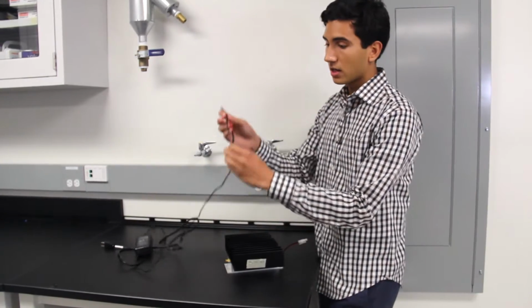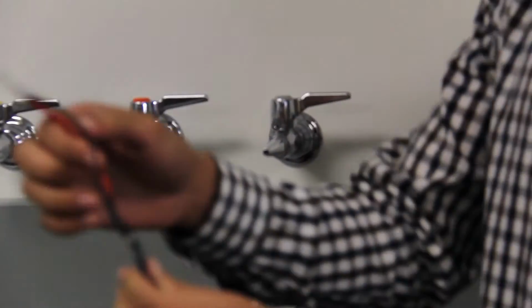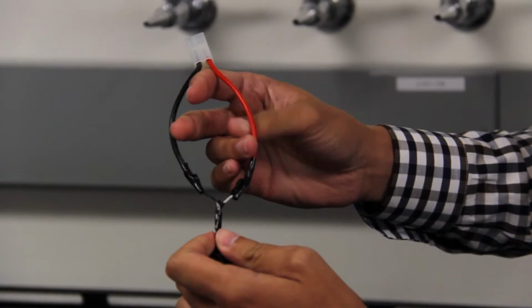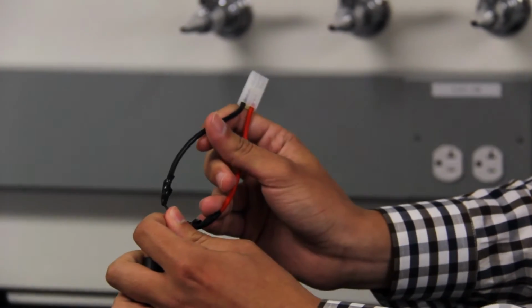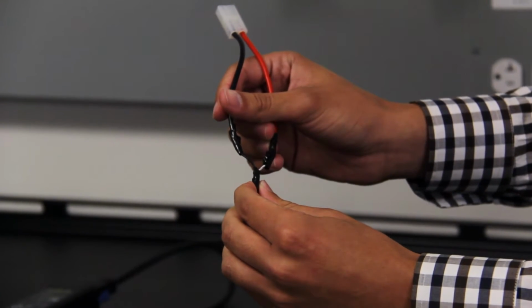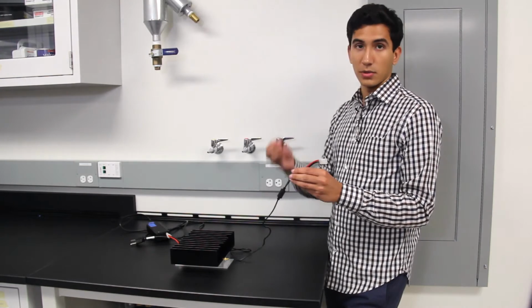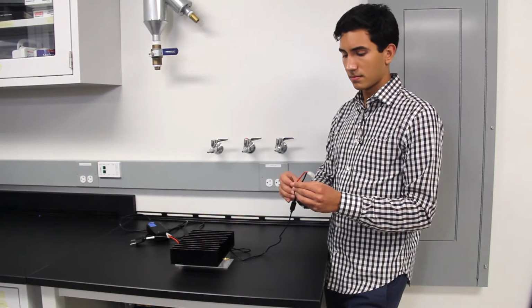We begin by cutting open the cord of the AC to DC power adapter. When you cut it open, you'll find 2 smaller cables inside. Typically, the colored cord will be your positive. After you solder your connectors to the wires coming out of the power adapter, make sure to wrap them in black electrical tape so as to cover any exposed metal. You can even wrap the whole assembly in electrical tape for safety's sake.